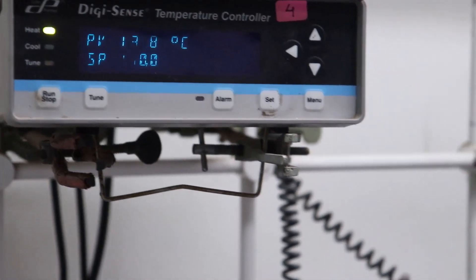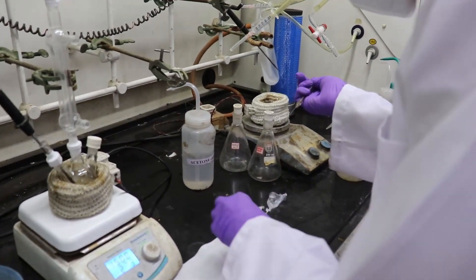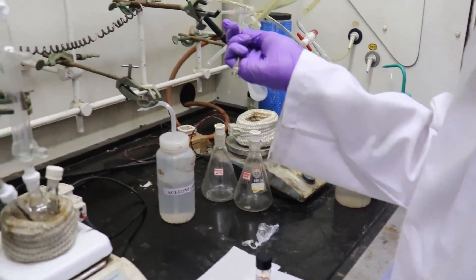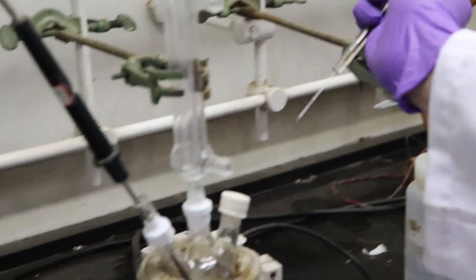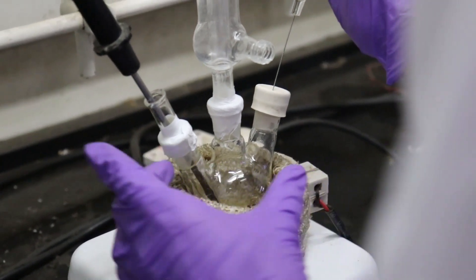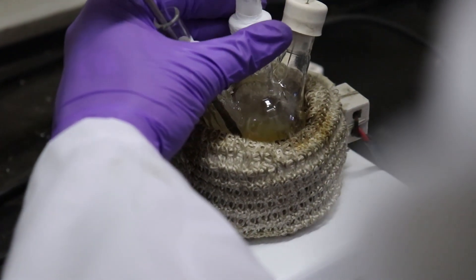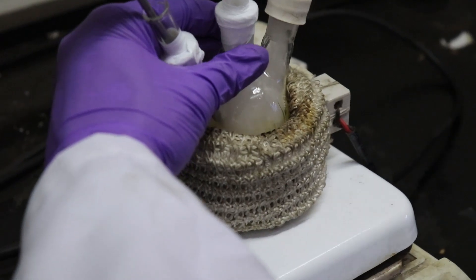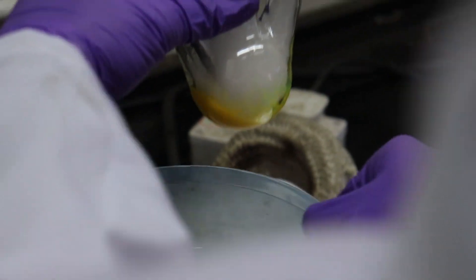After the moisture is removed from the system at high temperature, our system is ready to go to even higher temperature for the addition of the final stage precursor, benzoyl bromide. It is loaded in the syringe and almost ready to inject — and shots fired. The solution immediately turns yellowish-green. To prevent the growth of nanocrystals beyond a certain size, we need to quench the reaction by dipping the entire solution in ice-cold water.